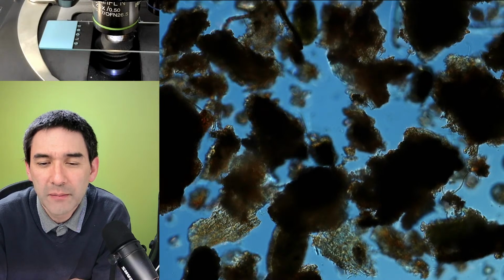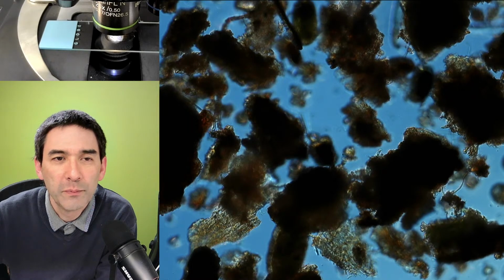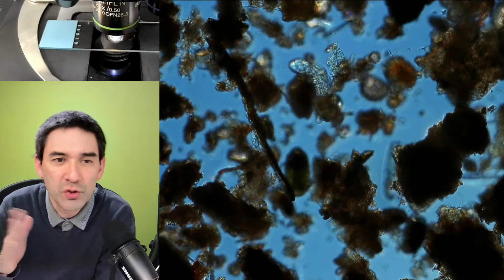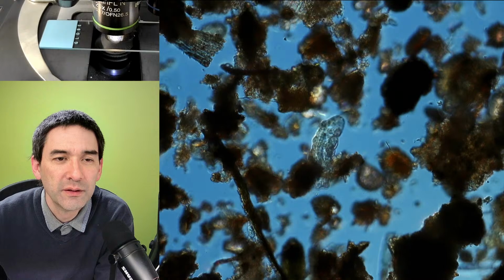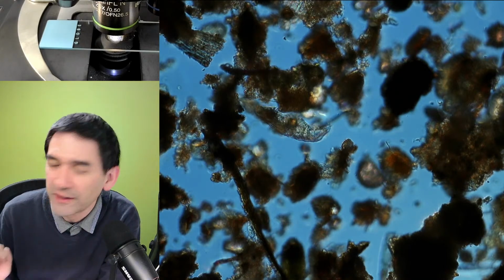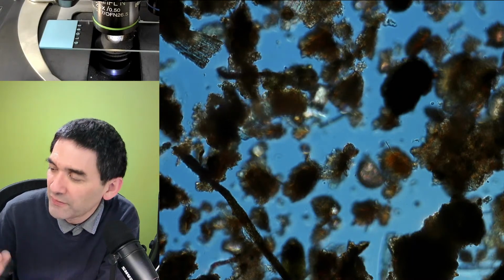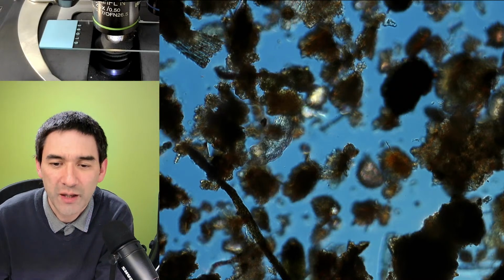The light method might be good for secondary separation after the Baermann funnel. Yeah. So basically, once you've collected it like this, maybe there is a possibility to make them move into a certain direction. So I'm not using a cover glass right now. That's why I cannot go up higher with the magnification. Otherwise, I'm going to touch the water droplet, which I don't want to do.